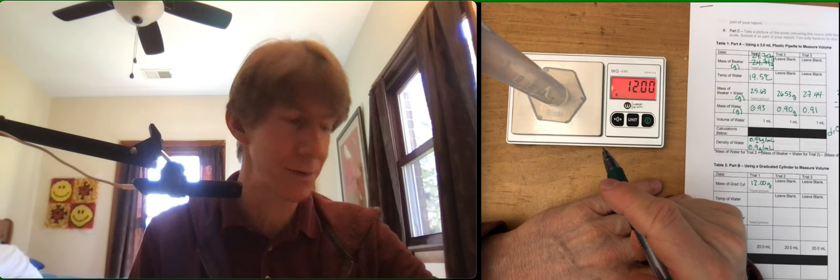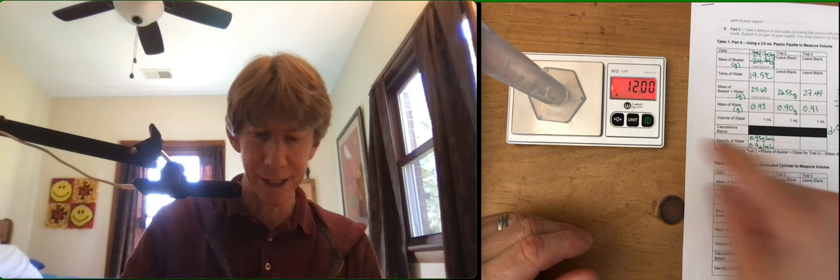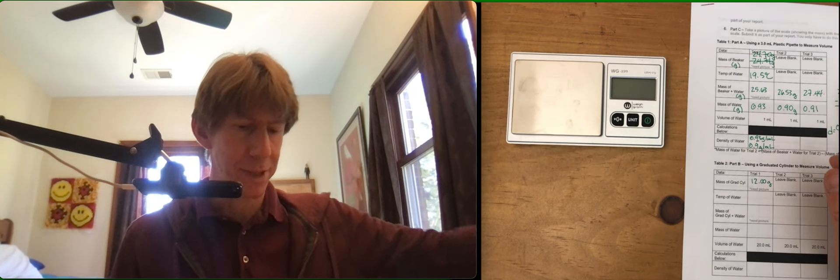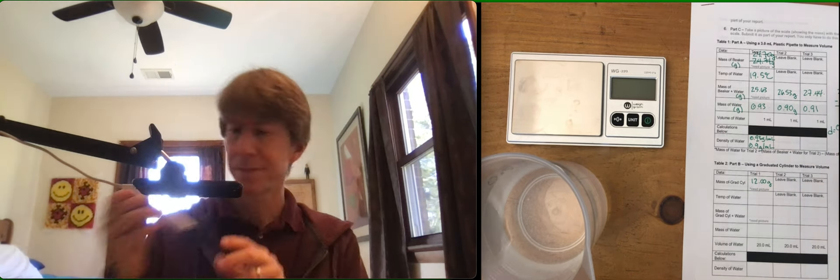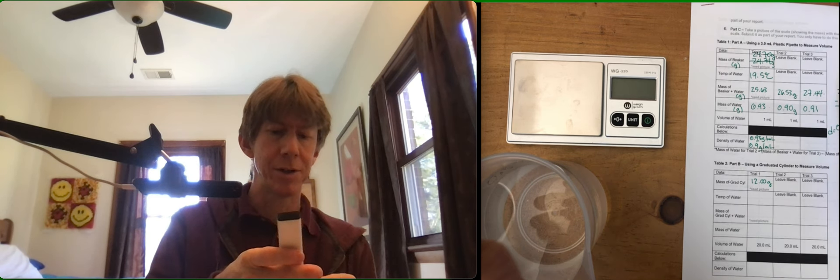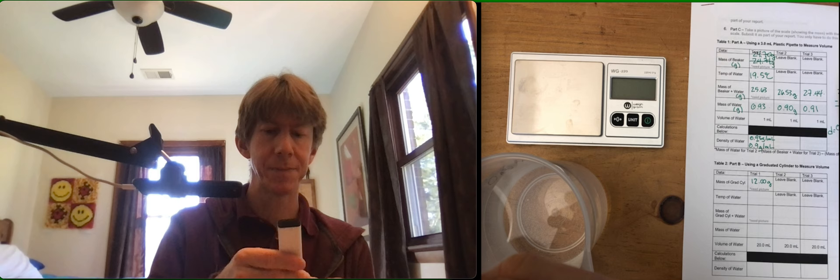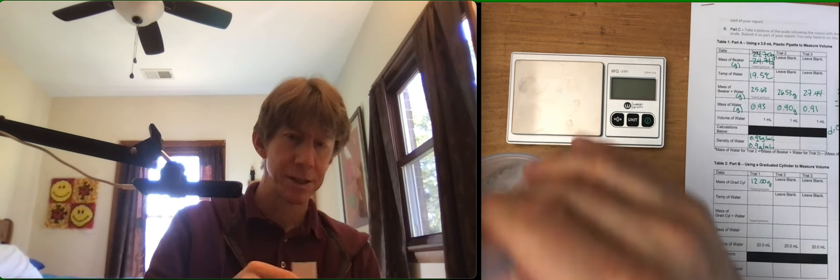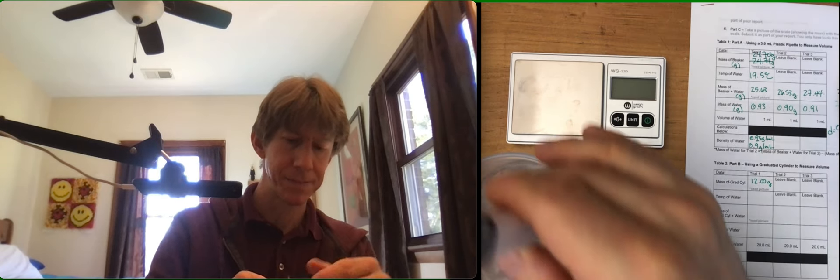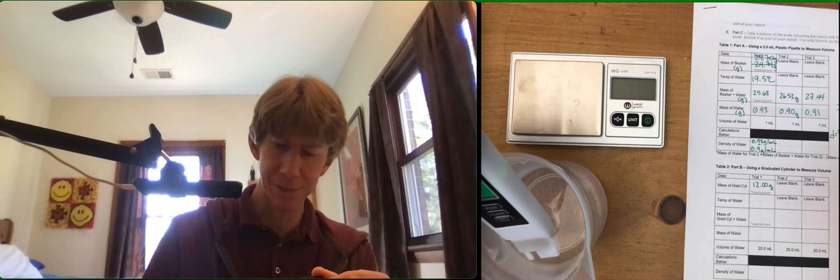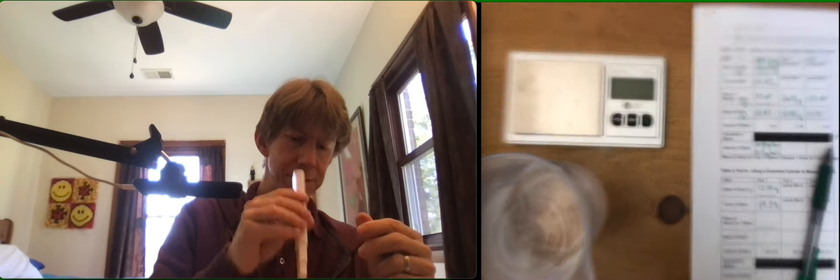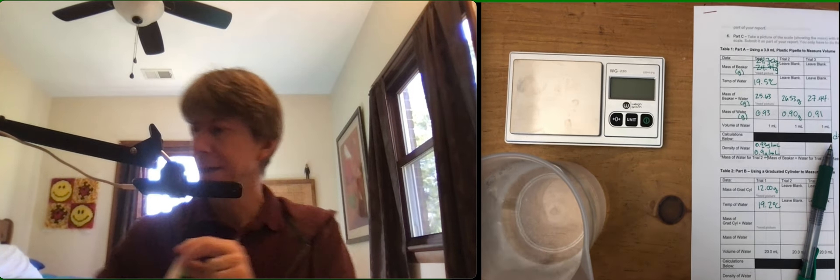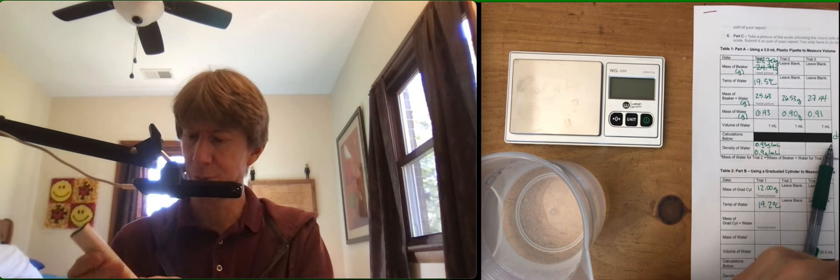Record the temperature of the water again. So I've got my water right here. I've got my temperature probe. I turn it on and then I go mode, mode, and swirl it a little bit. It seems to be pretty constant. This time it's 19.2 degrees. I'm going to give it a little shake and dry it off with my napkin over here. Put the cap back on, turn it off.